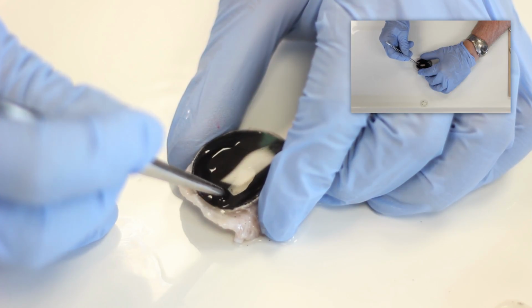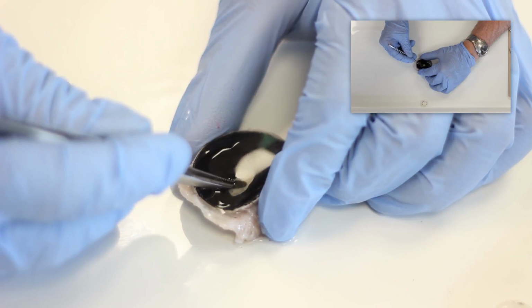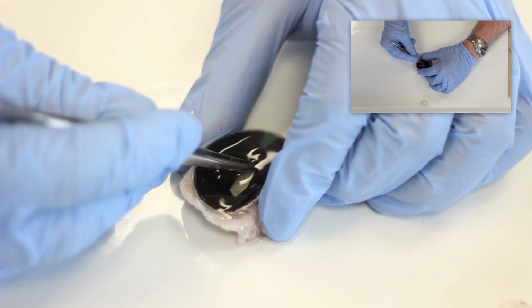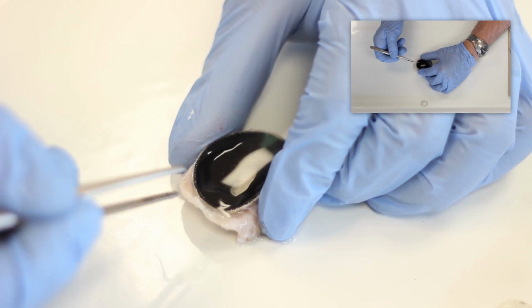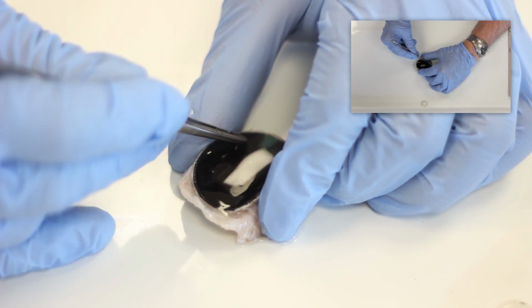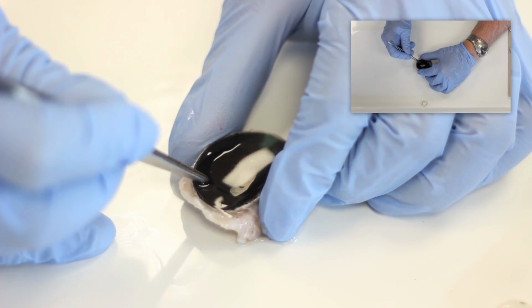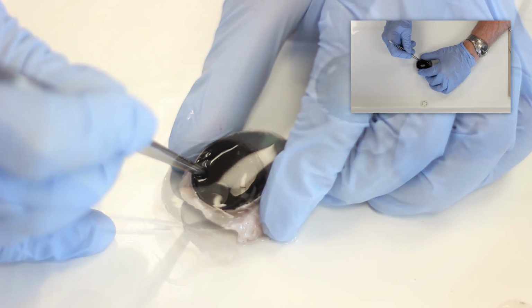The ciliary body produces the aqueous humor that travels through the open pupil and is drained through veins that are found in the anterior chamber of the eye in front of the iris. The other purpose of the ciliary body is to put tension on the lens and regulate the size of the lens to focus for far and near in the process of accommodation.